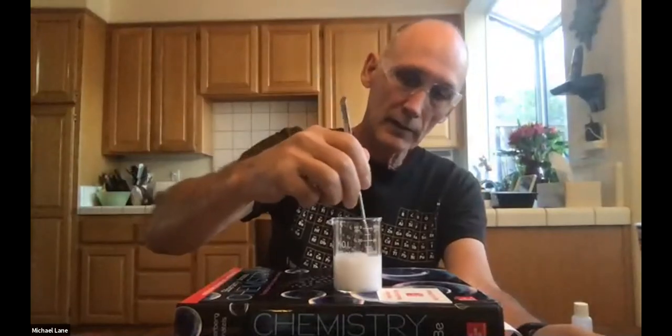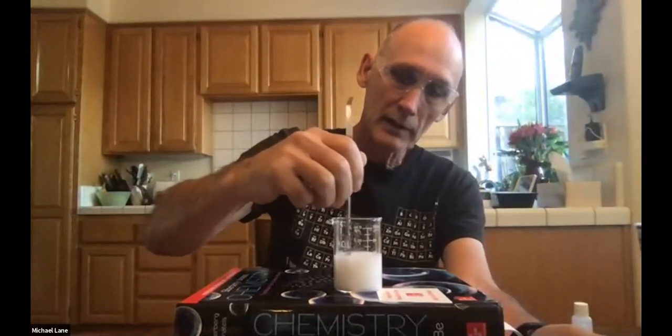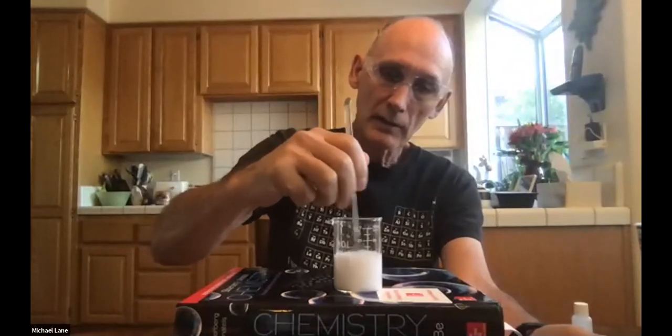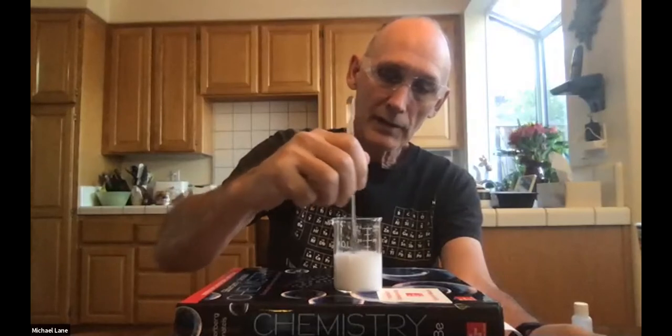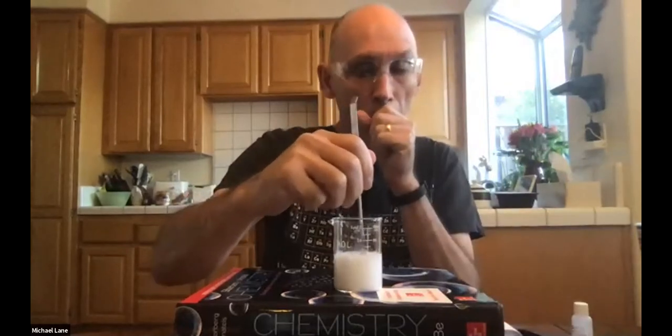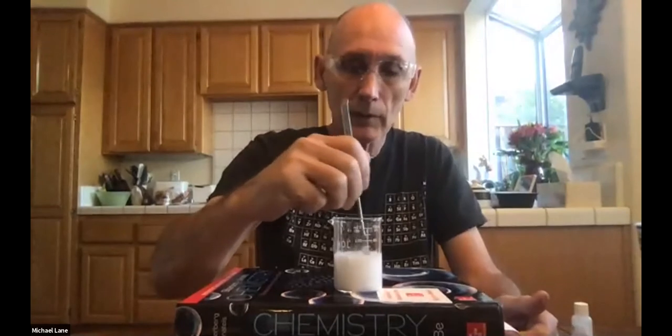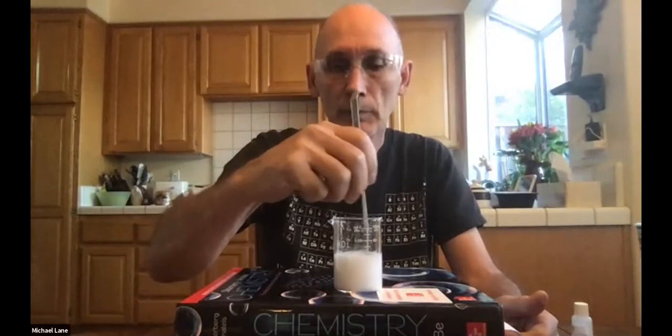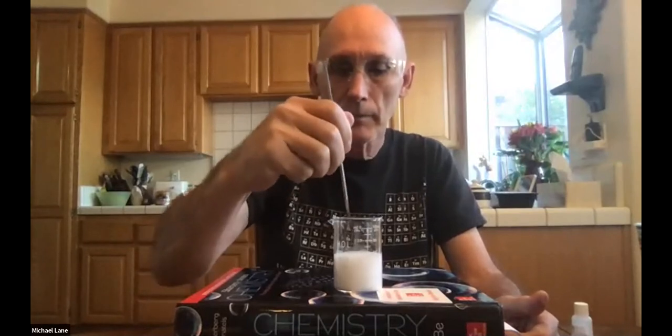Okay, so we've got that. It's best to, of course, stir that up a little bit to make certain that the reaction has had an opportunity to occur. Some reactions take hours or days or weeks or months. When I was in graduate school, I had reactions that literally took months to proceed to completion. And so having this reaction over in a matter of seconds is really rather convenient.